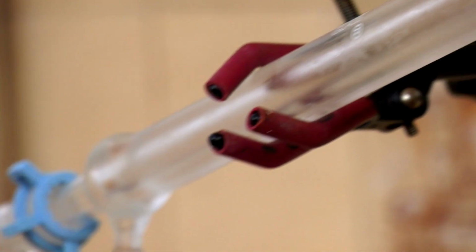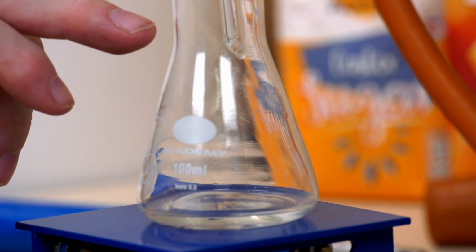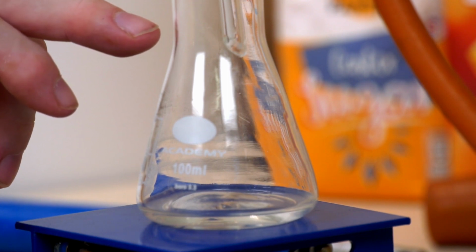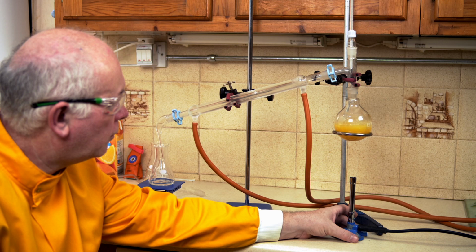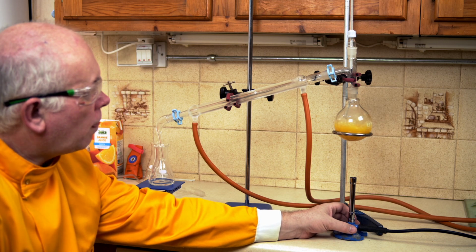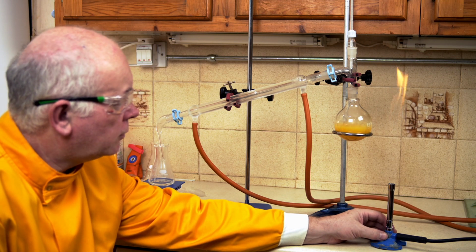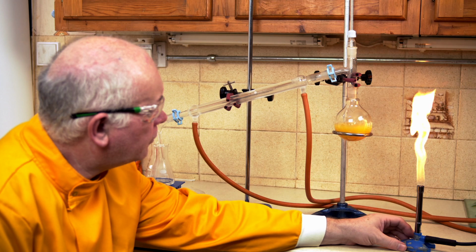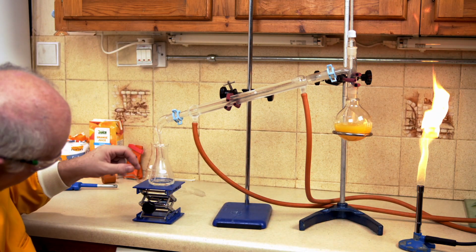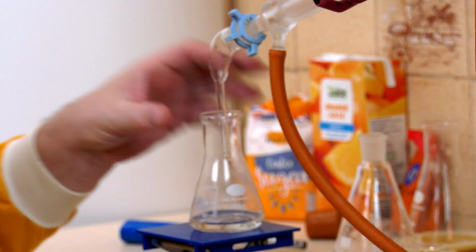And if we catch down here, you might just see some alcohol coming out, dripping at this end. Let's do a little bit more heating up. So we're boiling now quite nicely. It didn't take very long to heat this up, simply because the alcohol in there boils at a much lower temperature. And we've got this steadily coming off, and I've got a fair amount of alcohol coming out of there.